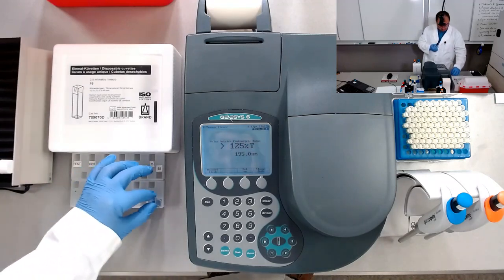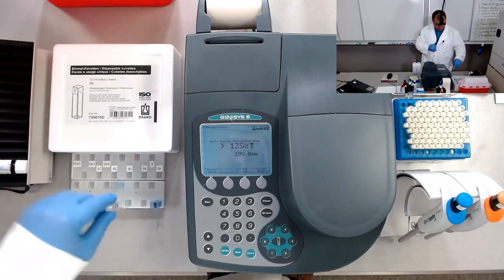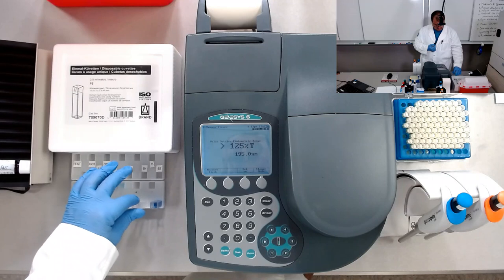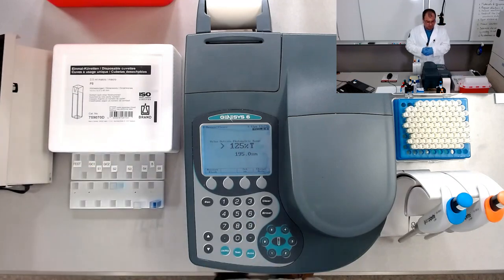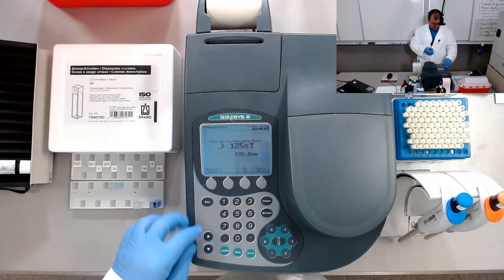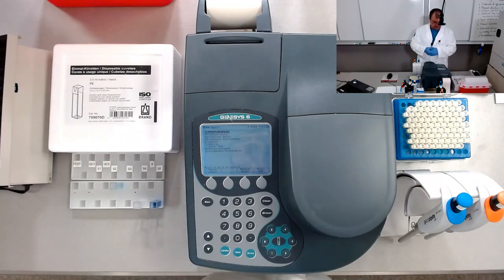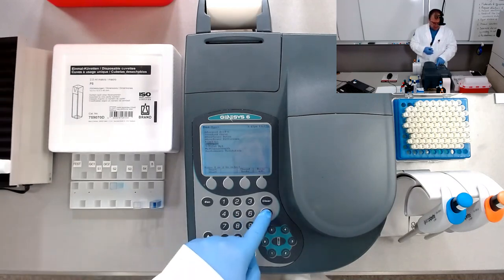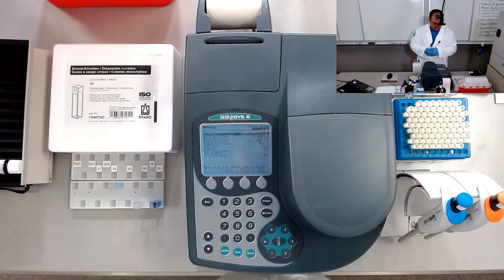We are going to have in here the sample, and we have in here the blank, the distilled water as blank. We have the instrument in here. We'll go and in test, go to scanning. Okay, again, enter.